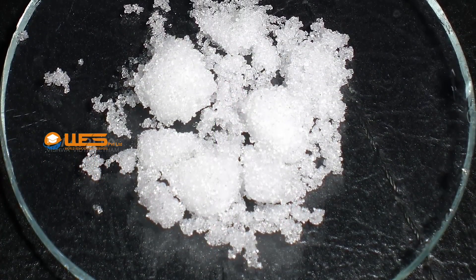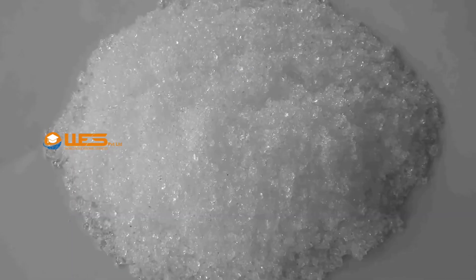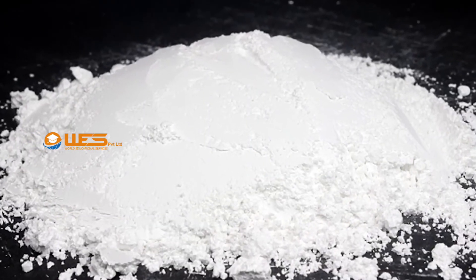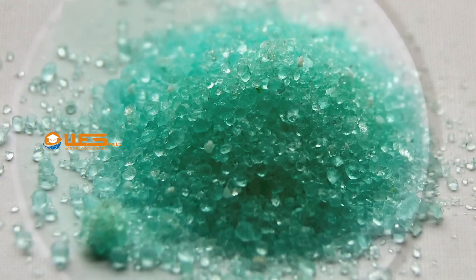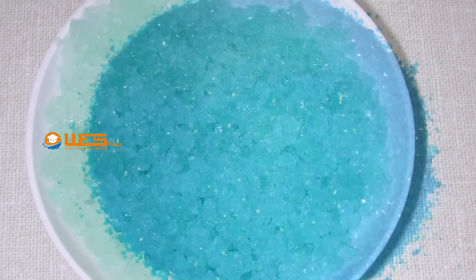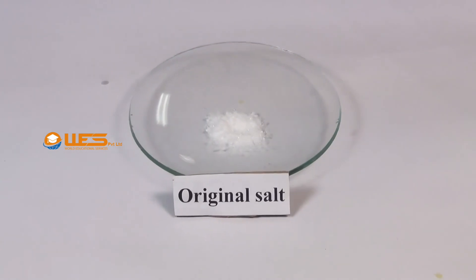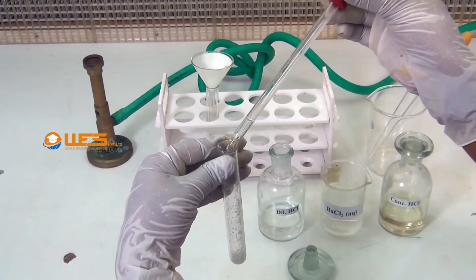Sulphate ion forms many salts like sodium sulphate, potassium sulphate, barium sulphate, etc. Very well known coloured salts of sulphate are green vitriol and blue vitriol. Our aim here is to test the presence of sulphate ion in a given salt.